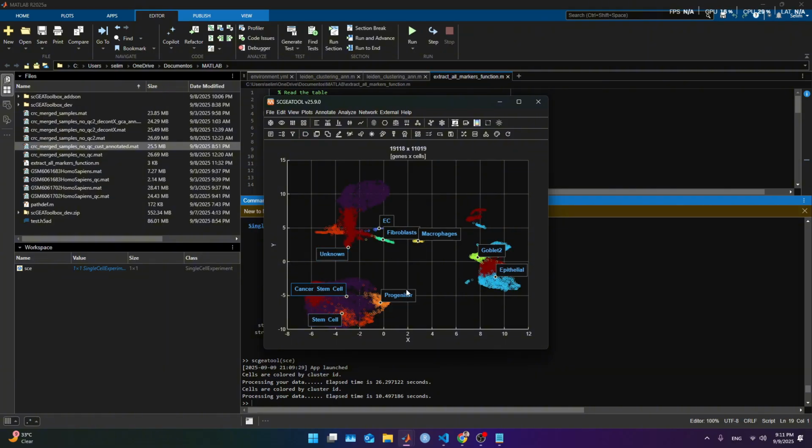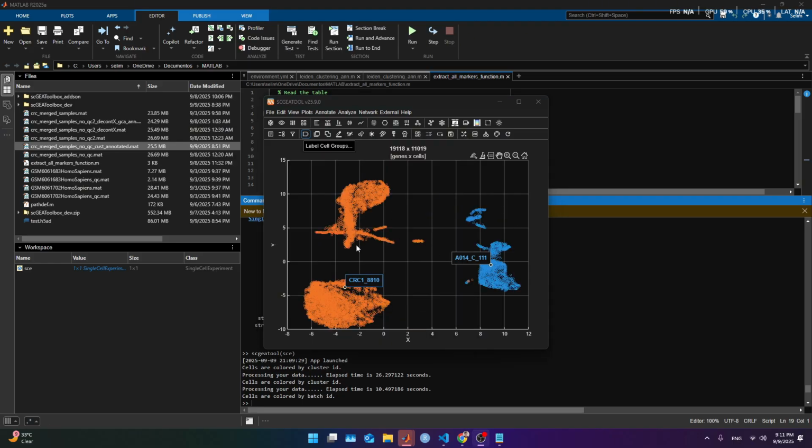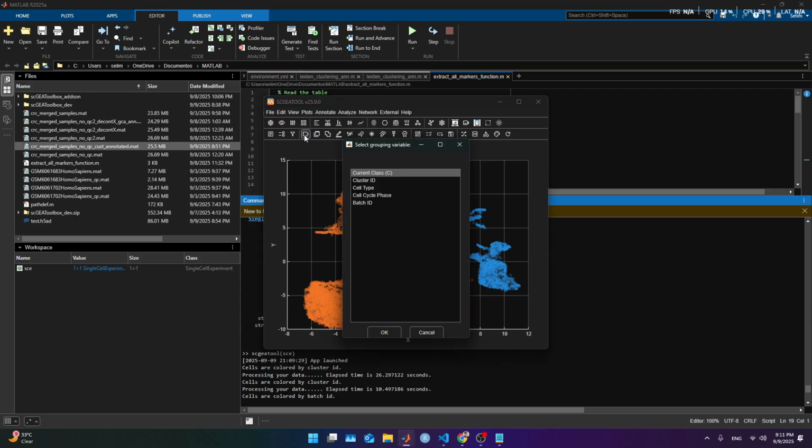Stem cell, cancer progenitor. It looks very similar to before, but now, for example, we have these 2 communities. This unknown is here. This unknown is here. I think this is fibroblast. Potentially this is fibroblast. No, this is fibroblast here as well. Here is stem and cancer stem cell. That's what we got. If we look at the batch ID, those are still separated. And cell type.